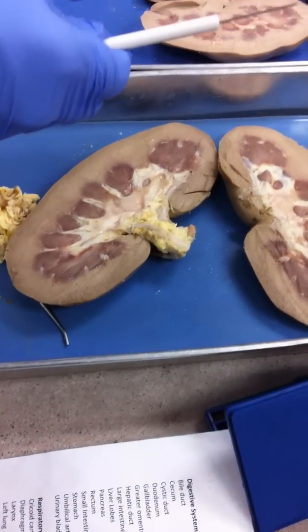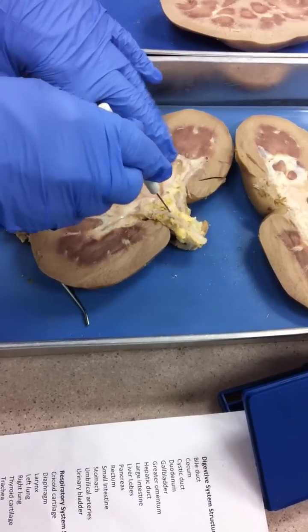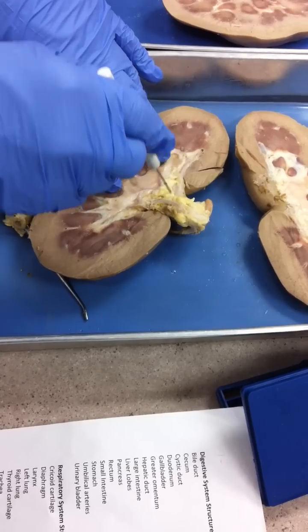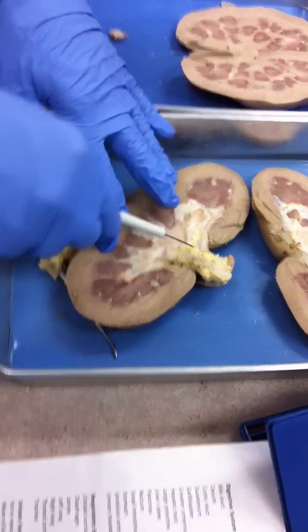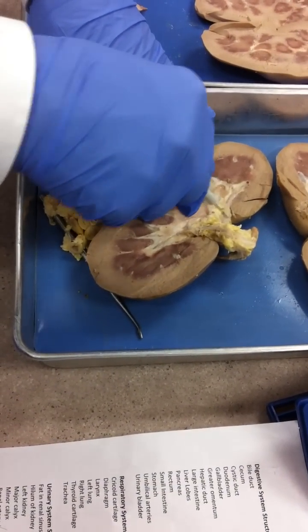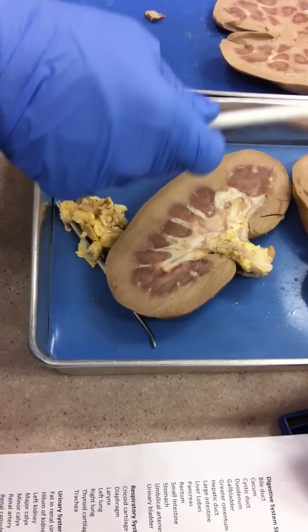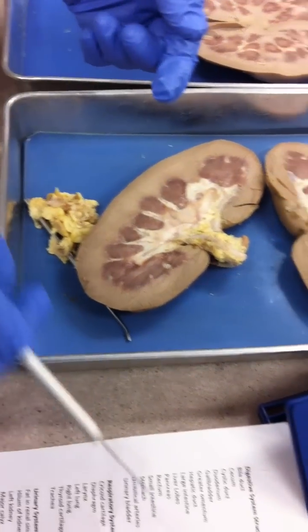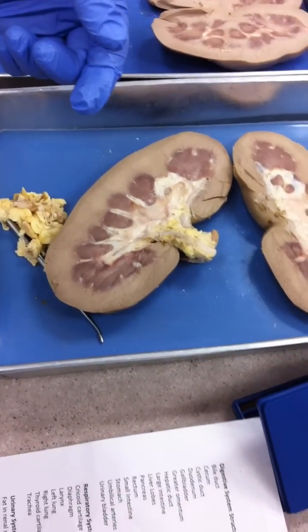The hilum of the kidney encompasses three structures: the renal artery, the renal vein, and the ureter. I'm going to have a pin with a little white sticker on it, with arrows going in both directions — that gives you a clue it contains three structures. Everything in between the arrows is your three structures. That's the hilum of the kidney — spelled H-I-L-U-M of kidney.